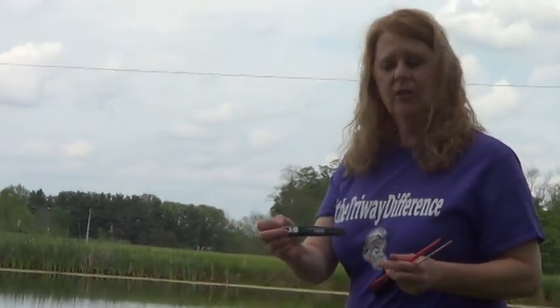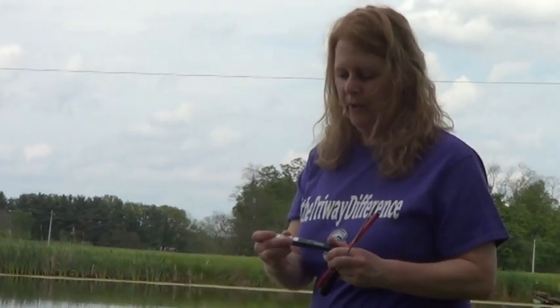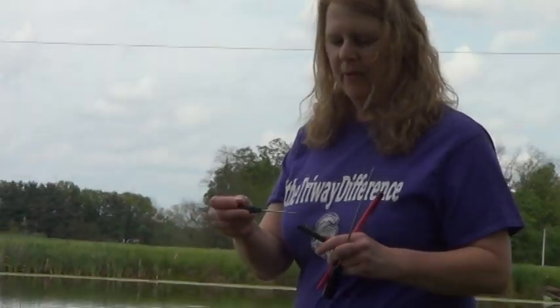There's another thermometer, it also looks like this, and it's used the same way. You just pull the cap off like this and do the same thing. Measure the temperature. When you're done, you can turn the thermometer off and put the cap back on.